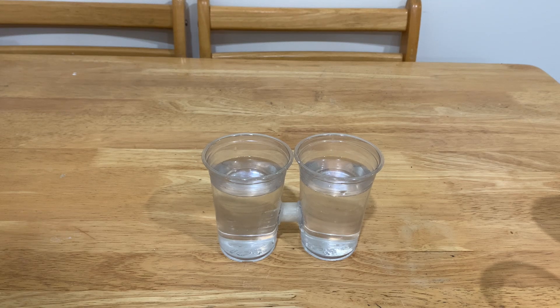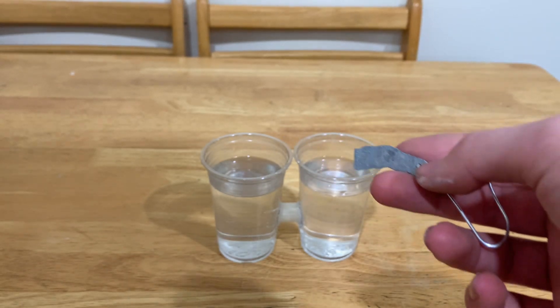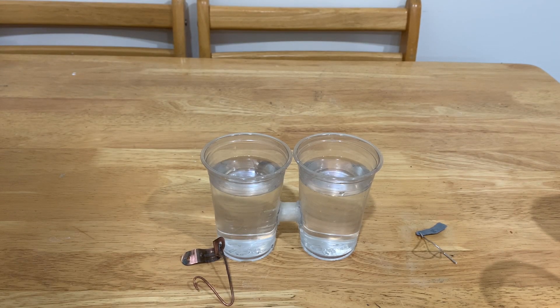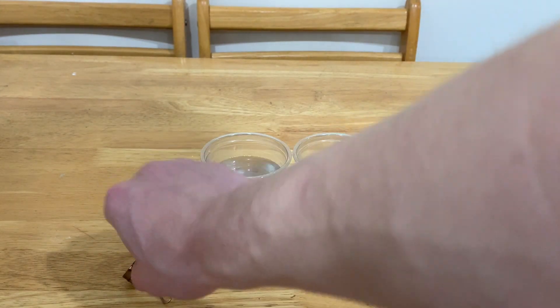The actual reason I'm using these instead of pencil lead is that they have a higher surface area than just a piece of pencil lead, and higher surface area makes the current stronger. Now if you're going to use my setup, I would recommend maxing out the surface area on these things however possible, as a higher surface area means a higher current. Now if you are hoping to get hydrochloric acid out of this reaction, you definitely need to use pencil lead instead of aluminum, as carbon does not react with chloride in any way. We however are focused on making sodium hydroxide instead of hydrochloric acid — we'll go over how to make that in a separate video. Now what you need to do is dip the electrodes into opposite cups.